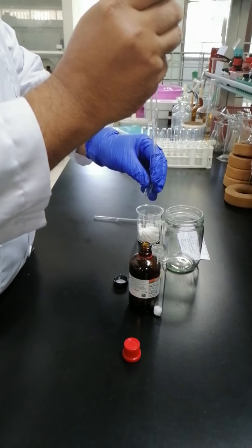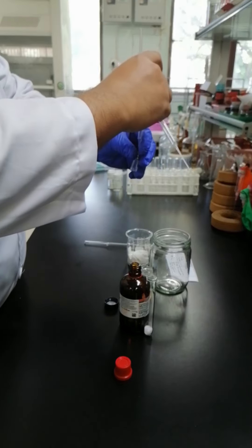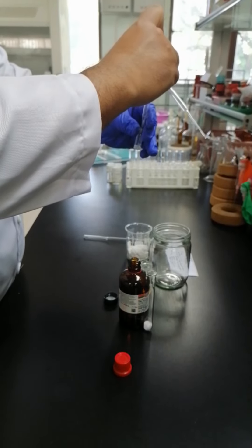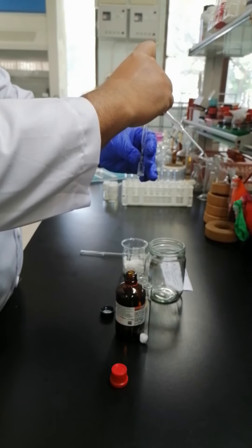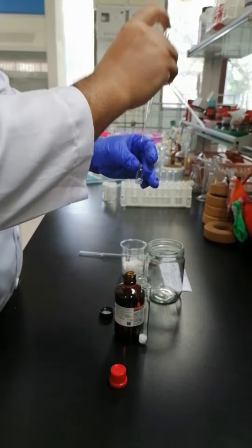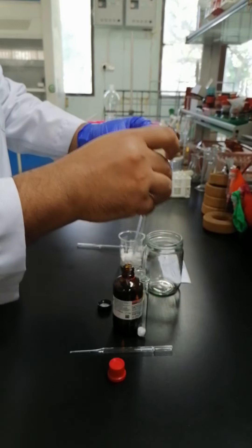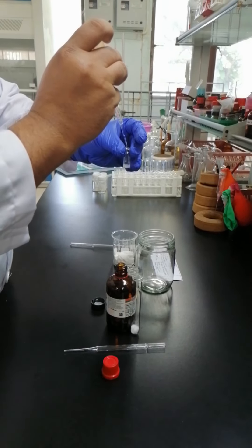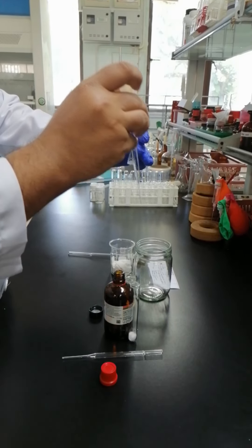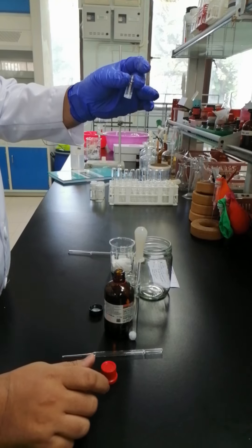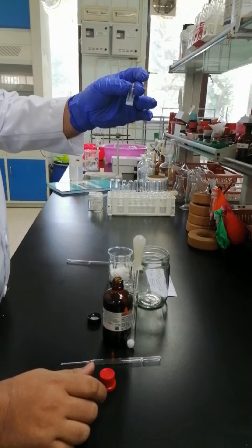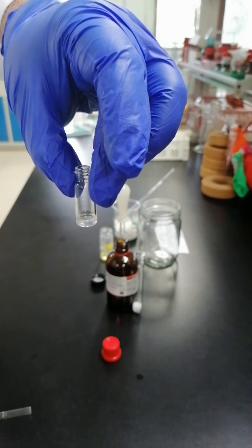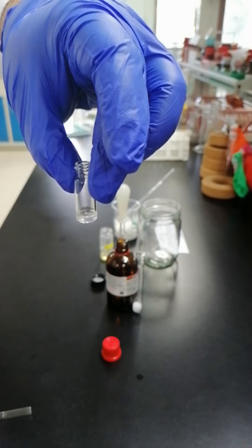Transfer a few drops of chloroform D into the small vial and try to make sure to dissolve the samples. This sample should be clear, no cloudy and precipitate.